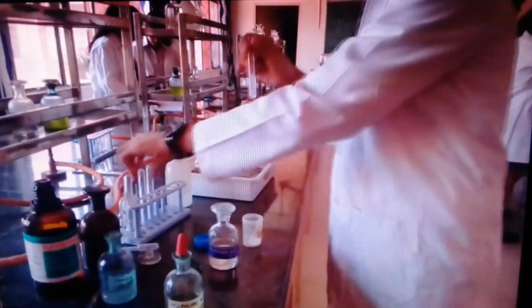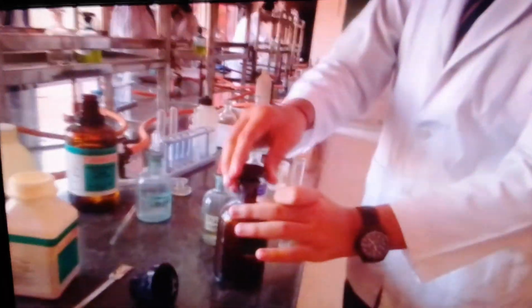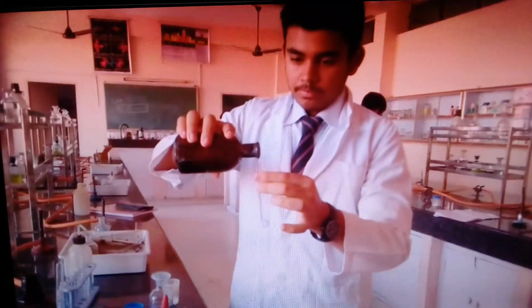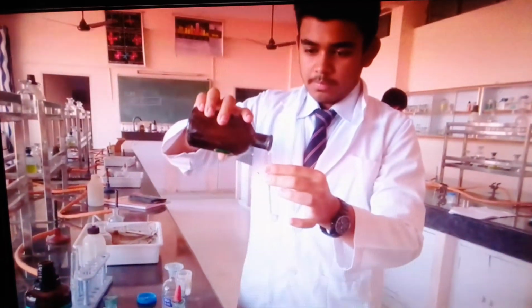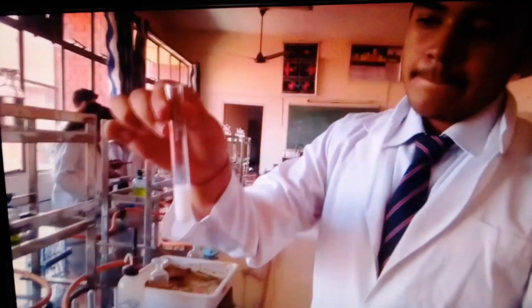Fine. Take 1 ml of this in a separate test tube. Because we'll be using the OS, if you need it ahead for your cation analysis, you can keep it for the cation analysis also. 1 ml of OS. To this add silver nitrate. Silver nitrate is always added to the original solution. On addition of silver nitrate solution, you can see the formation of a white PPT. This white PPT is of silver chloride.